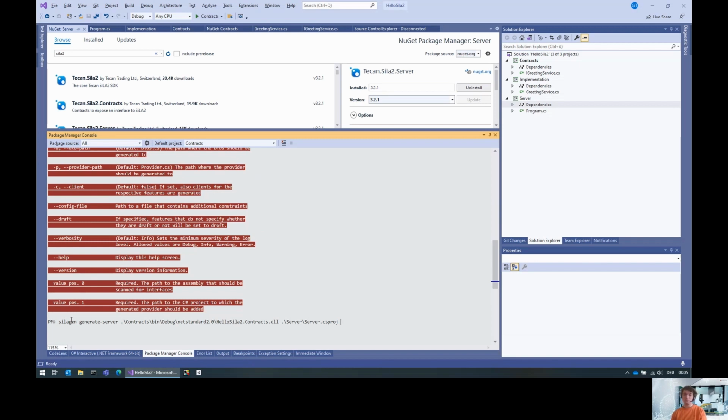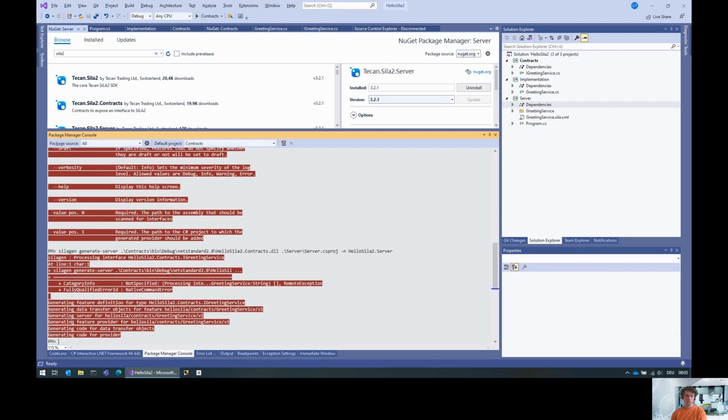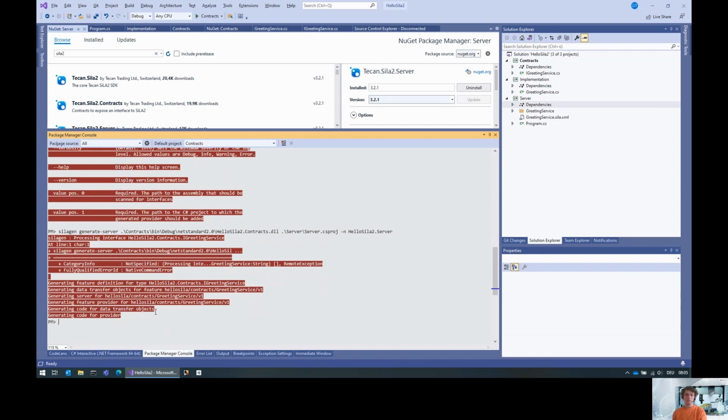And lastly, we can actually do additional options. In this case, what is typically useful is to specify the namespace. And the namespace will be hello SiLA2.server. And if we do that, you see that we get, unfortunately in red, some log messages like that. There's data transfer objects generated for us, a server code generated for us, a feature provider generated for us, and so on and so forth.